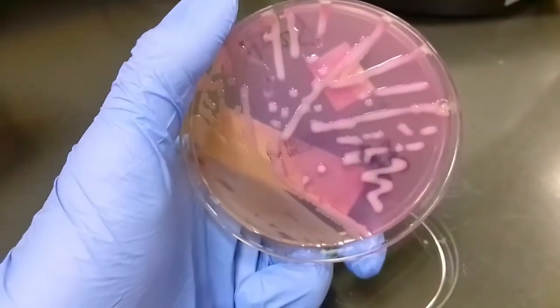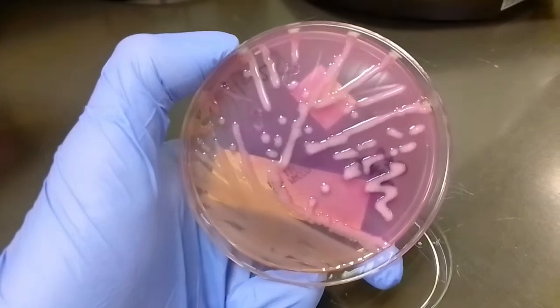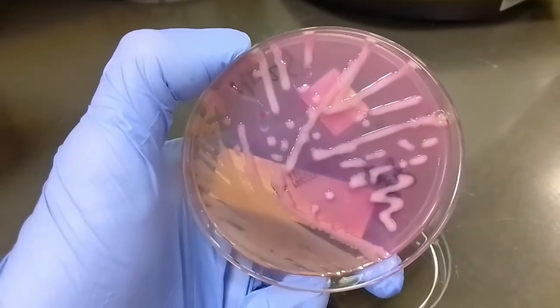We have something called e-swab made by a particular manufacturer, and we have to use that if you want to isolate anaerobic bacteria as well. Other swabs may not be suitable for anaerobic culture. In particular specimens you're going to be looking for particular bugs — for example, in urine it'll be E. coli, and in a respiratory specimen it may be Klebsiella pneumoniae or Strep pneumoniae.